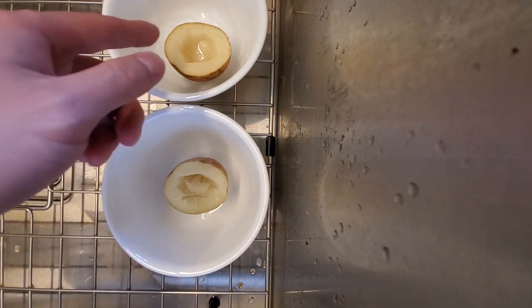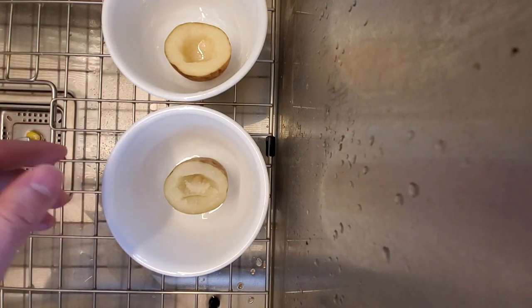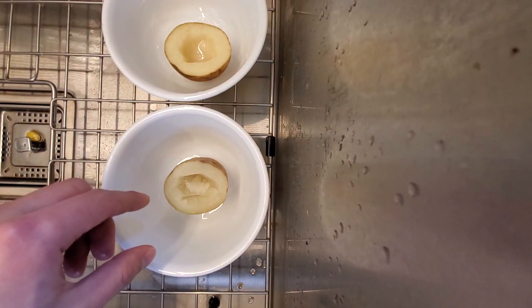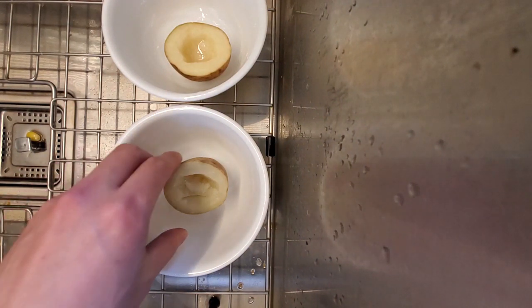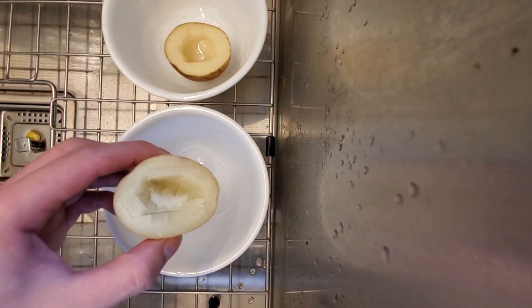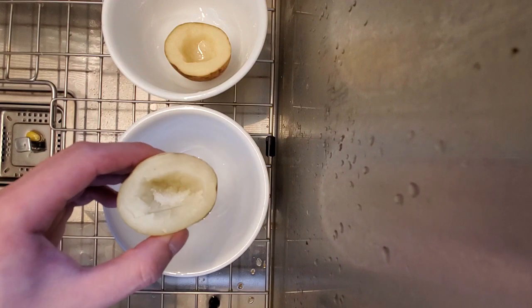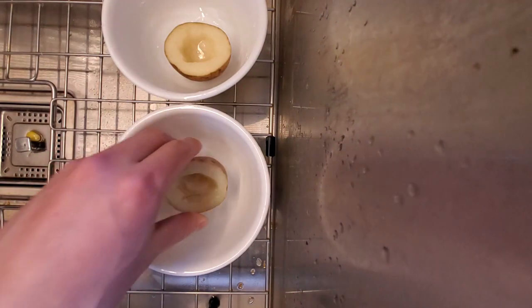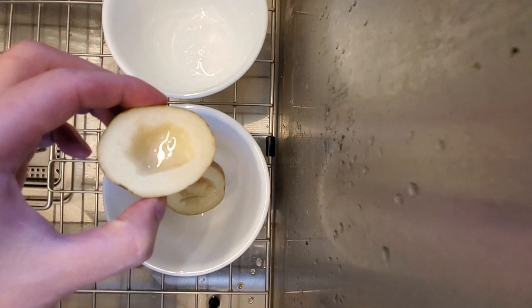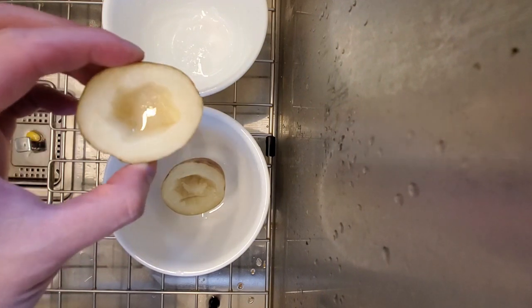Another reason is that, as we learned before, temperature can change the shape of proteins, and on the cell membrane there are proteins as well. If the proteins are changed in shape then they're not going to function the way they did before, and so diffusion cannot happen. These potato cells are still alive because the potato was not boiled, so diffusion can happen as normal.